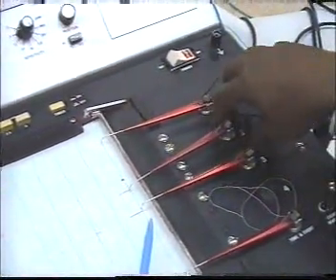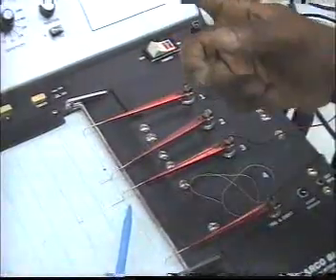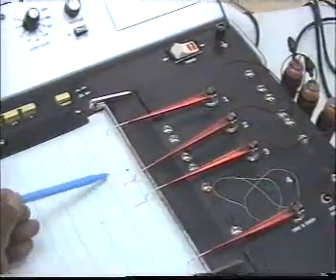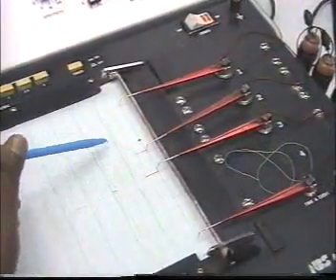And as I mentioned, the physiograph is a form of large galvanometer. So as a result of the electrical signal, the changing voltage will deflect the needle. When the needle is deflected, it will record the muscle action. So the muscle contraction will be recorded.